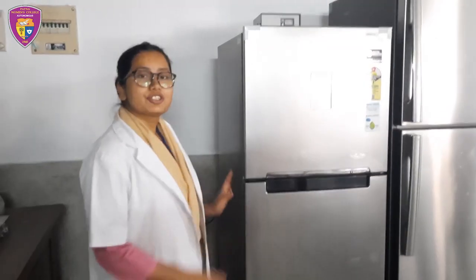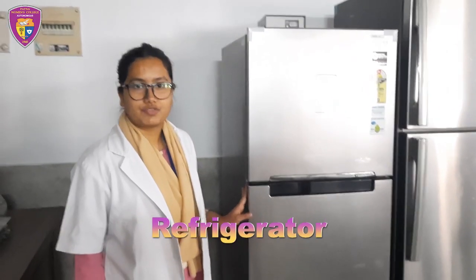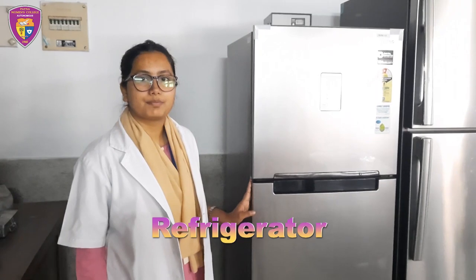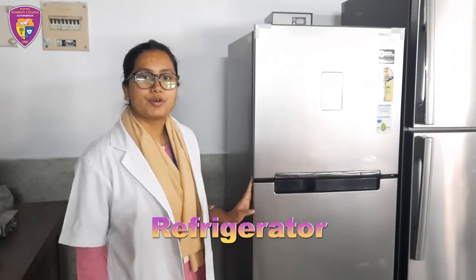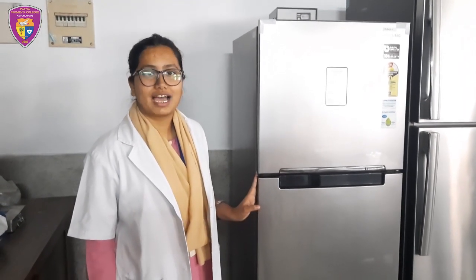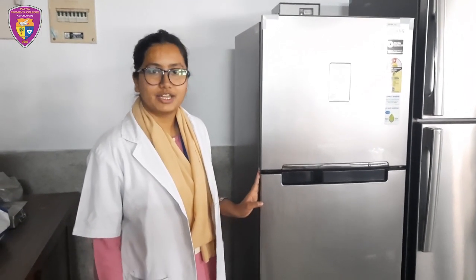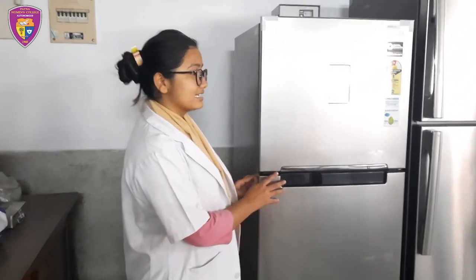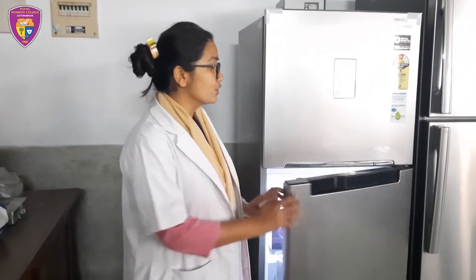This is a minus 20 degree Celsius refrigerator and it plays a very important role in the safe storage of vaccines, reagents and microbial cells. This is of huge importance in clinical, pharmaceutical and microbiological laboratories.